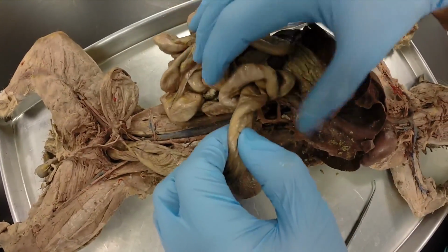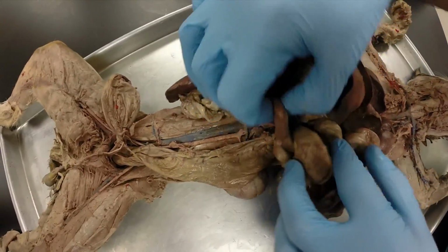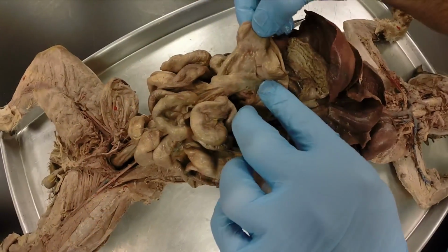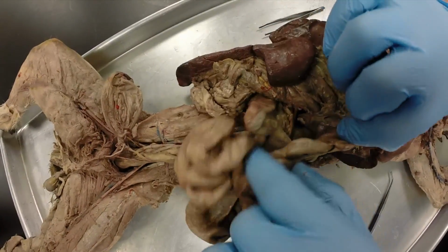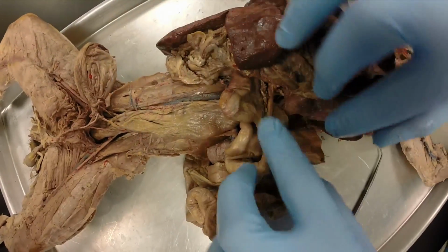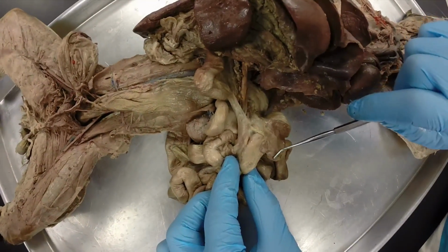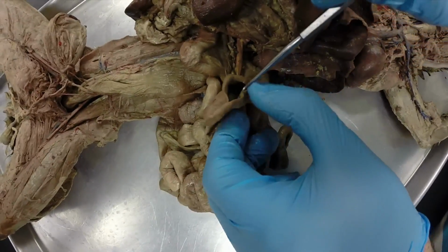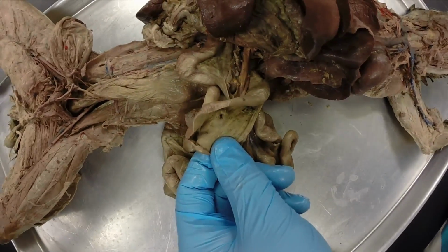And then if you look at where the small intestine enters into the large intestine, we call that area of the small intestine the ileum. And so right here, the small intestine is coming in, and this is now large intestine. And so this would be the ileum right here, this last portion of the small intestine where it enters into the large intestine. Now if you look at where it's entering into the large intestine, we have this little pouch right here. This is called the cecum. And if we open this up, we have our ileocecal sphincter right in there.